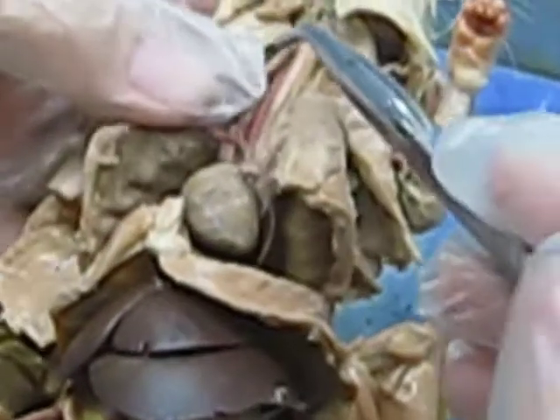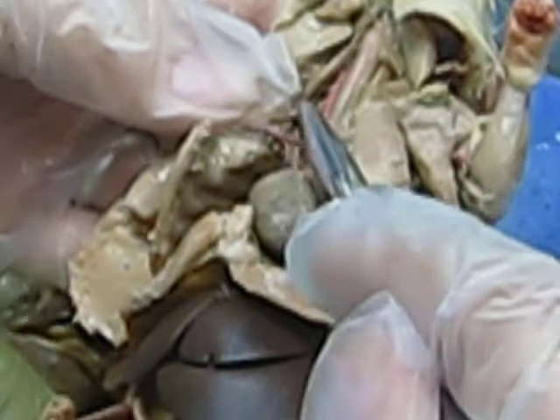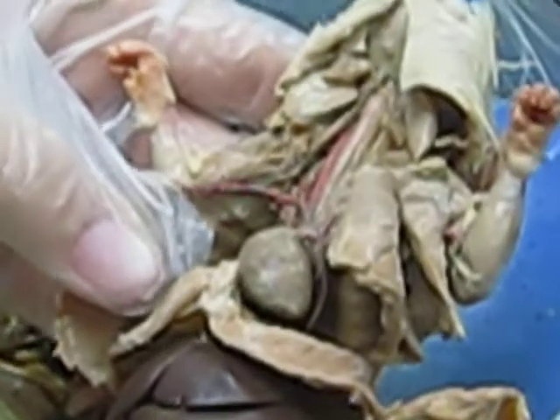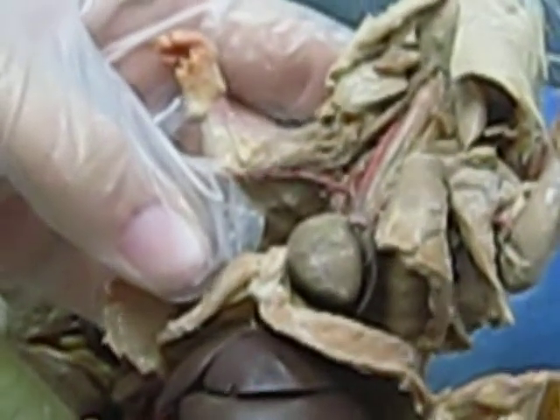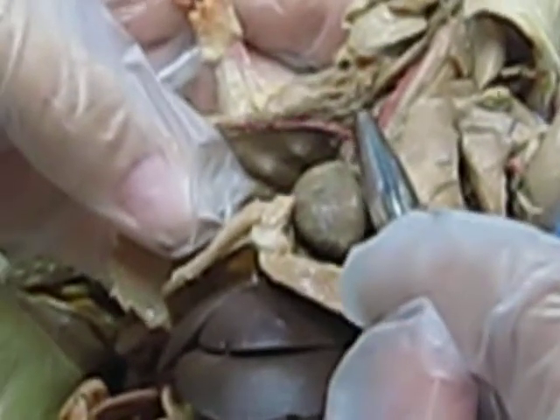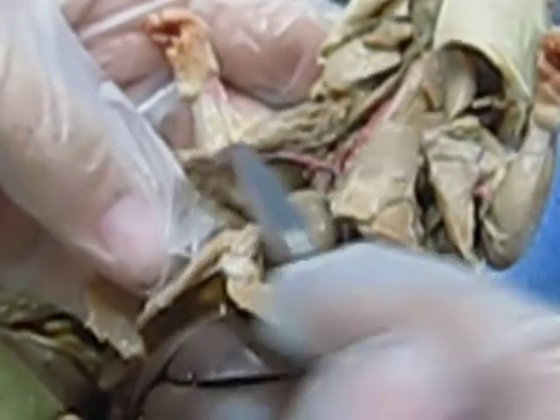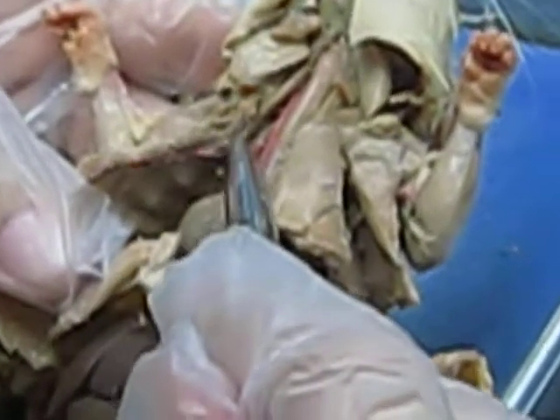Okay. Then you follow your right subclavian up and start looking for things that branch off of it. So, judging by the name of the artery, you can start identifying some of the arteries that we see here. Like this one. It follows the internal part of your thoracic cavity, so it makes sense that that would be called your internal thoracic artery. Right there.